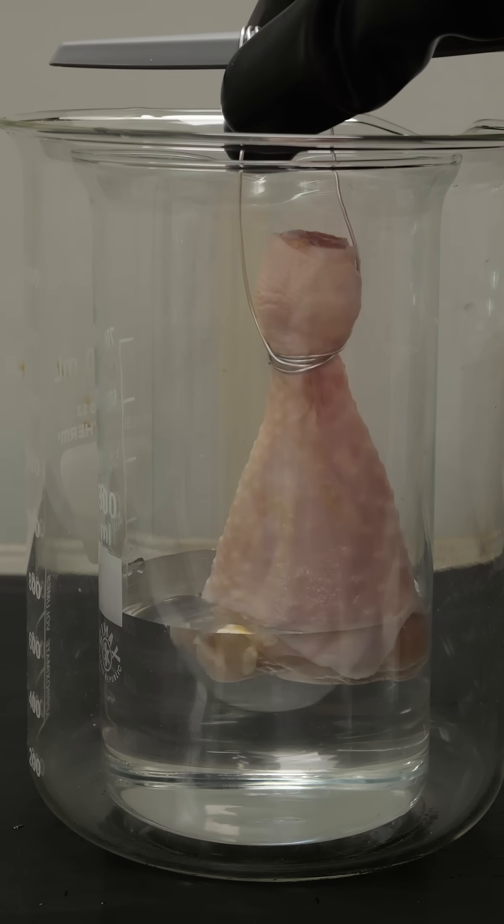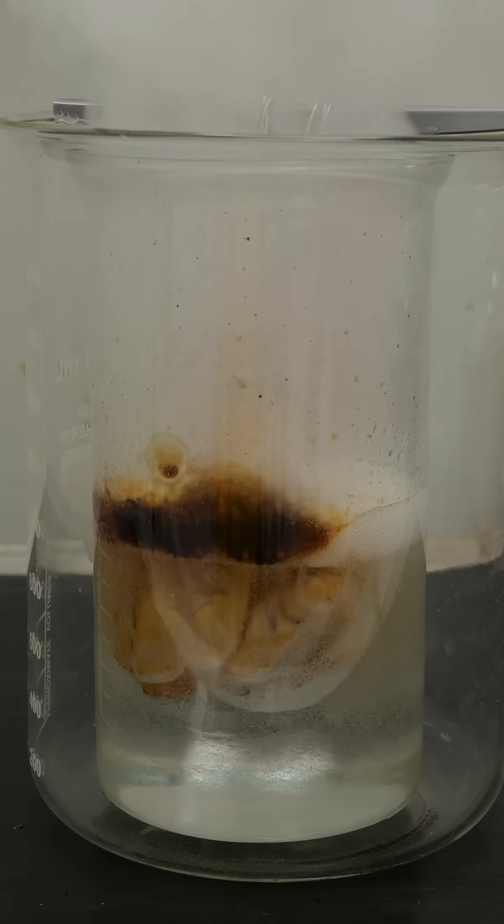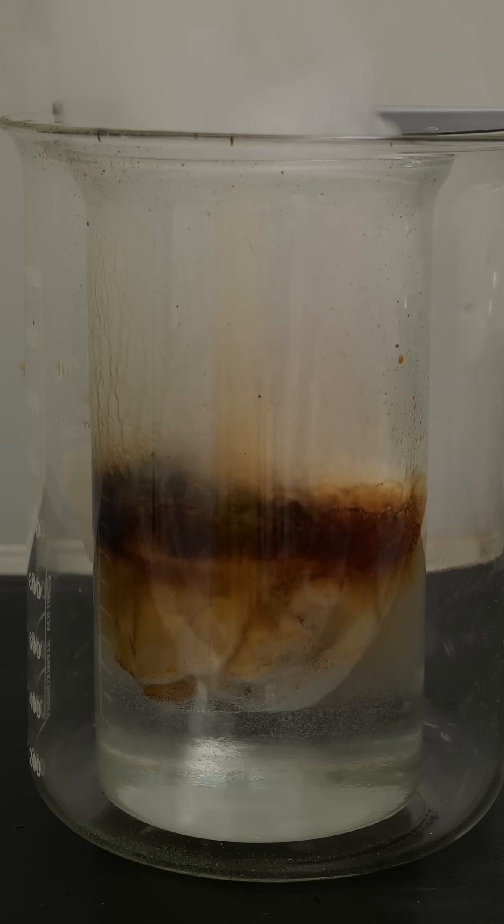When the acid comes into contact with flesh now, there's absolutely no stopping it. The chicken leg, complete with its skin and bone, is entirely dissolved, and that in a matter of seconds.